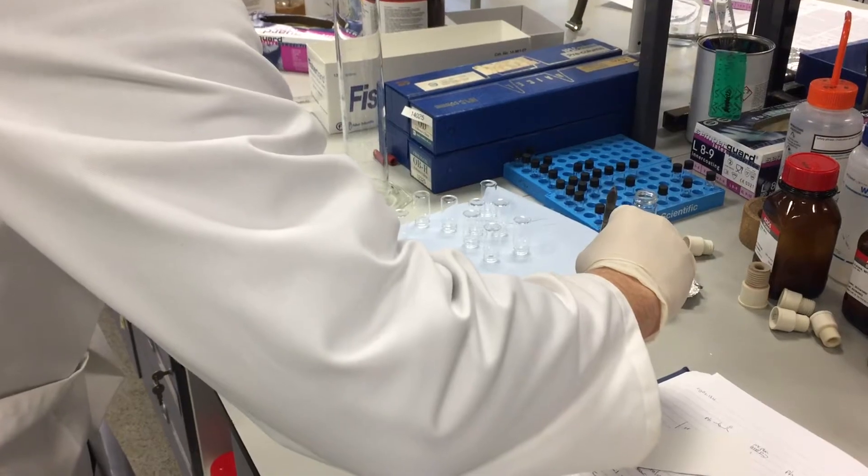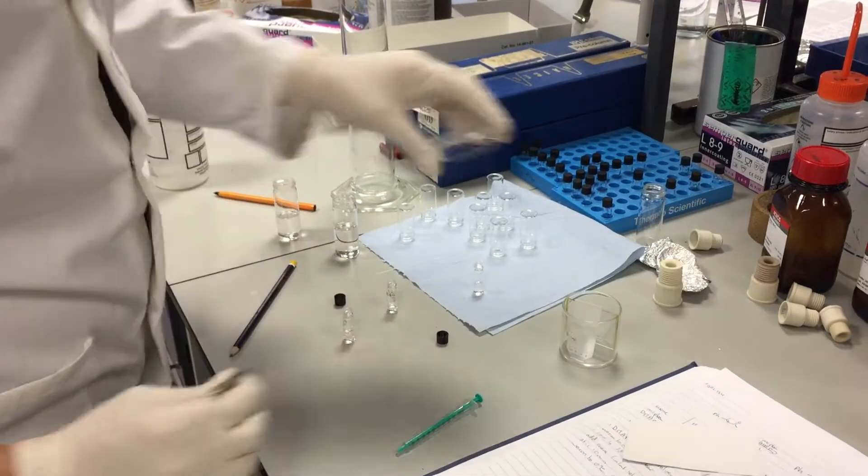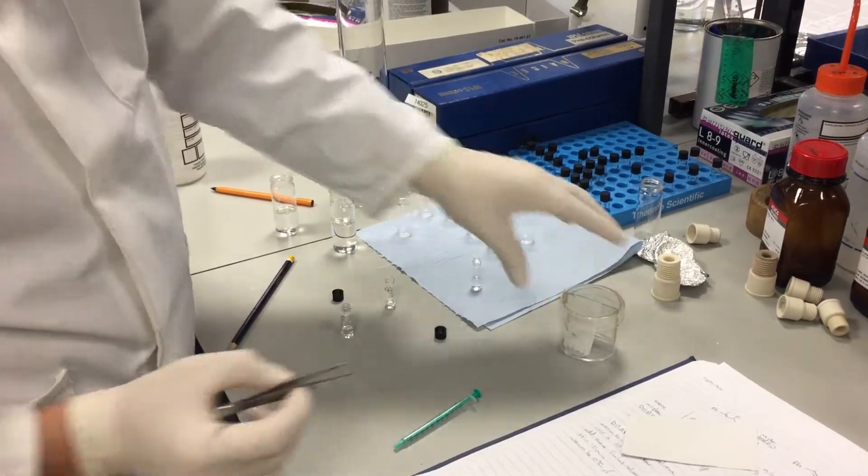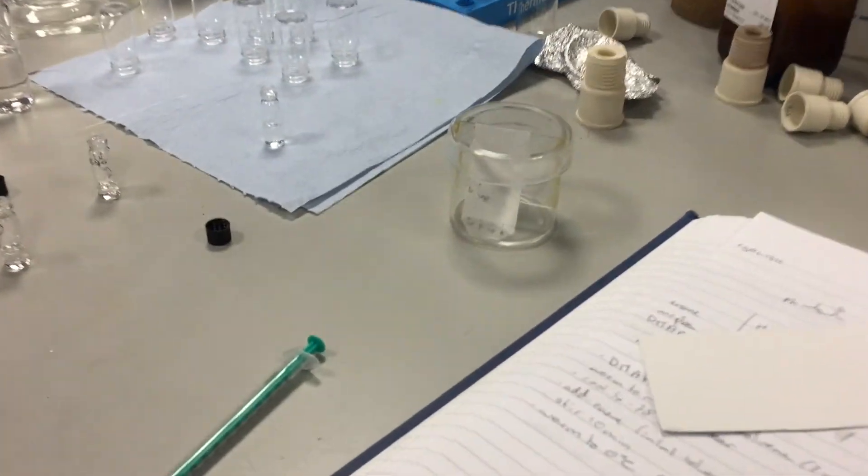Put it in, making sure it doesn't touch the sides of the flask. You'll notice that the solvent begins to rise on the TLC plate and you wait for that to run.